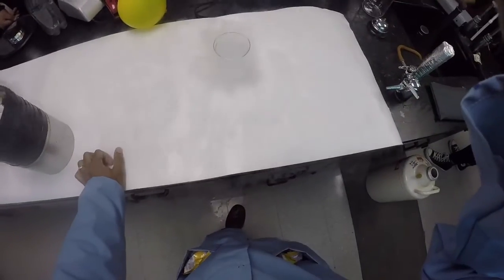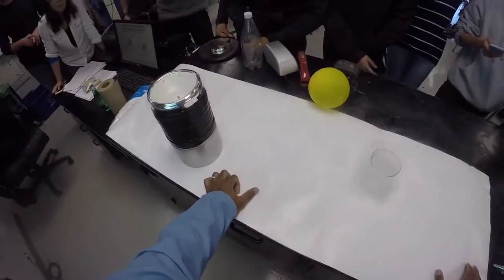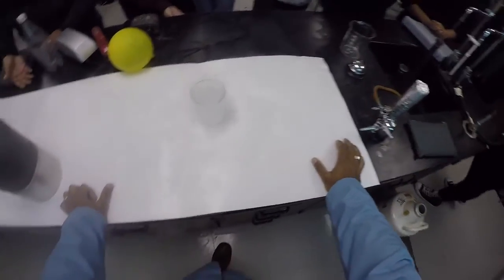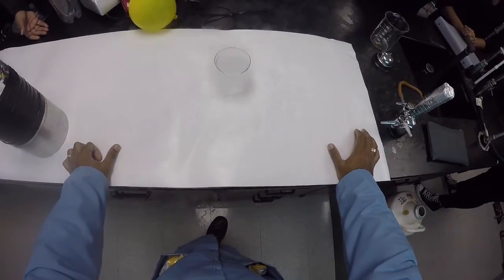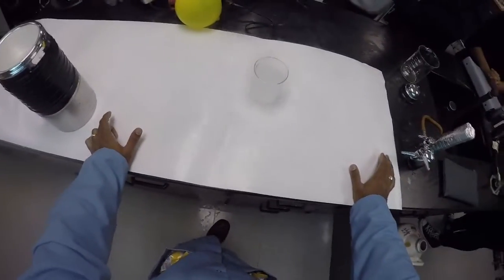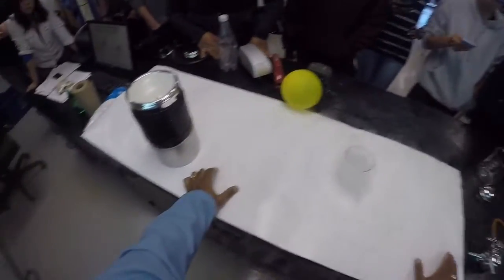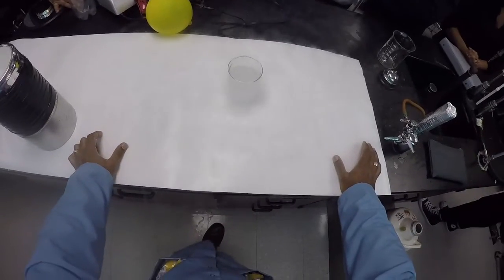It looks like it's boiling because it is boiling, because liquid nitrogen's boiling point is minus 323 degrees Fahrenheit, which is way below room temperature. So all it can really do at this point is boil. And so you're right to be concerned about the coldness.